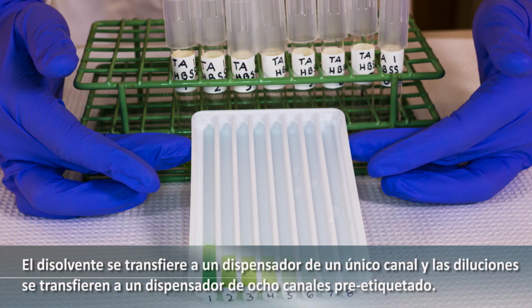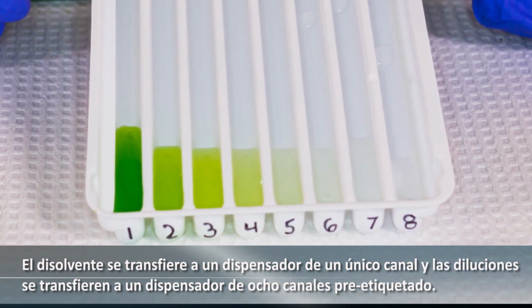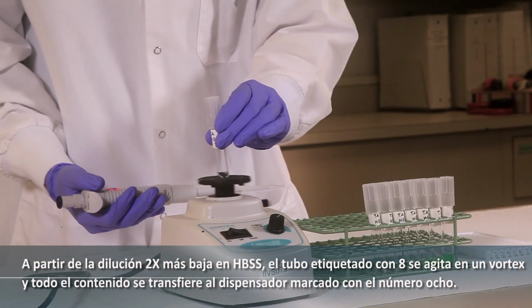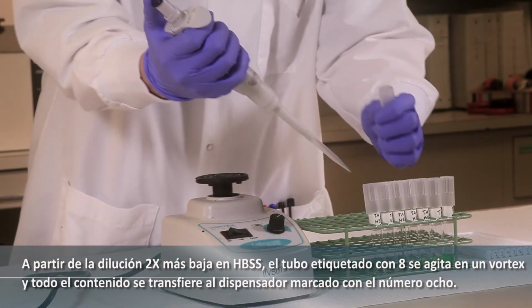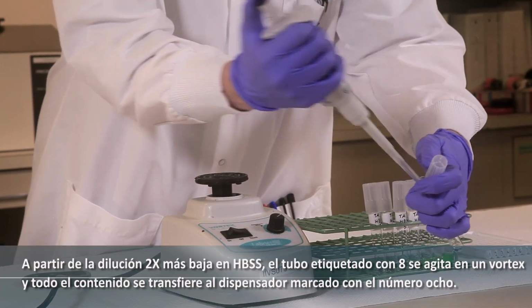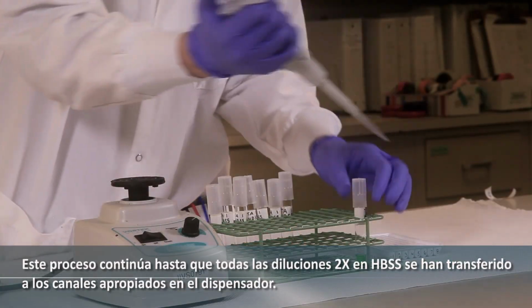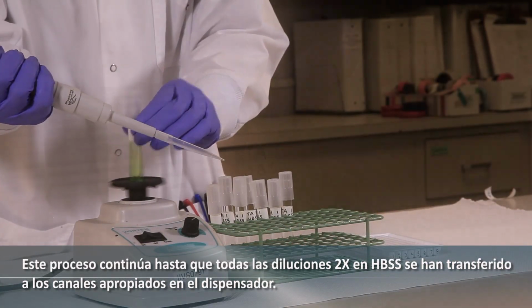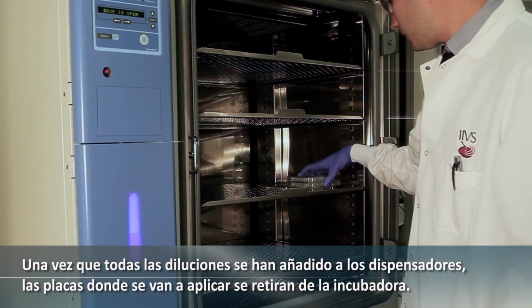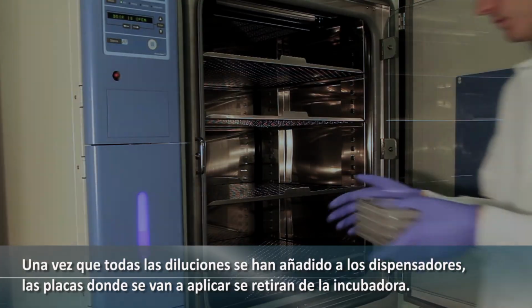The solvent control is transferred to a single well reservoir, and the dilutions are transferred to a pre-labeled 8-channel reservoir. Starting from the lowest 2x dilution in HBSS, the tube labeled 8 is vortexed, and the entire contents are transferred to the reservoir labeled number 8. This process continues until all of the 2x dilutions in HBSS have been transferred to appropriate channels in the reservoir. Once all of the dilutions have been added to the reservoirs, the applicable plates are removed from the incubator.